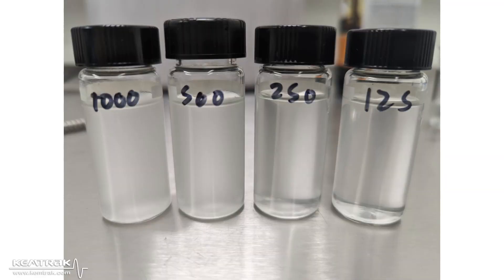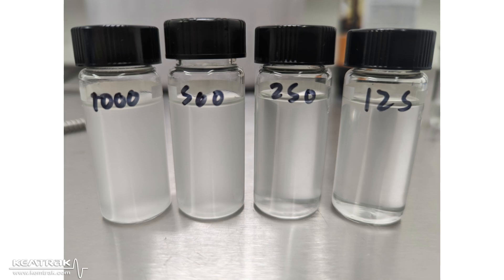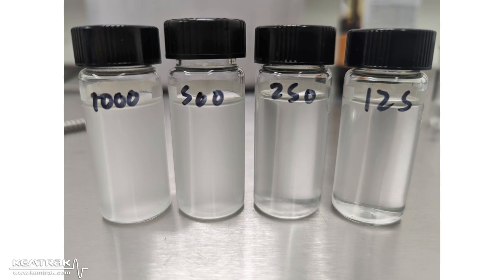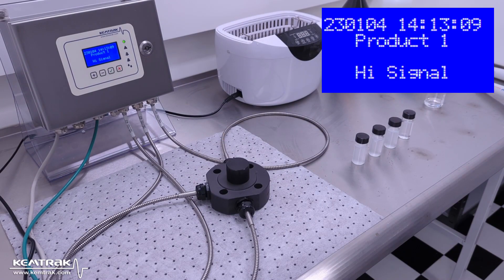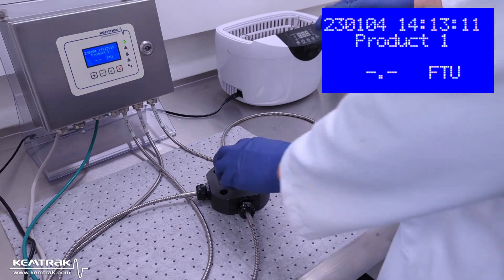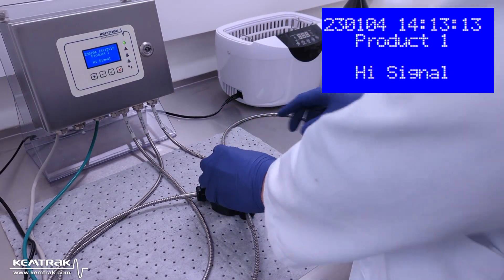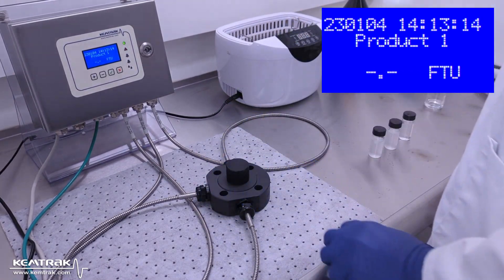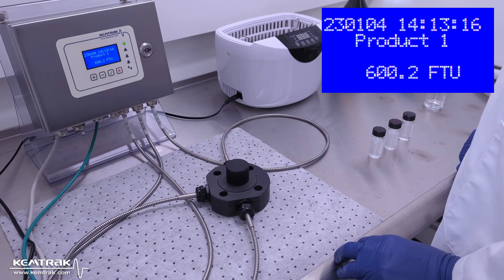The water is now dispersed in the kerosene for some time. I now measure the samples. Measure as soon as possible because the water will eventually separate from the kerosene.